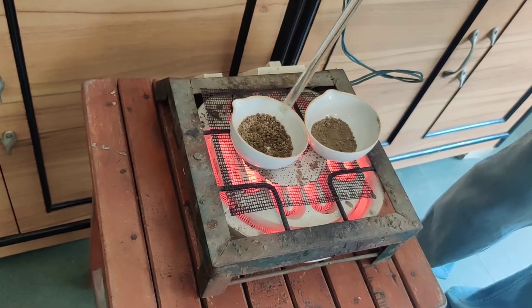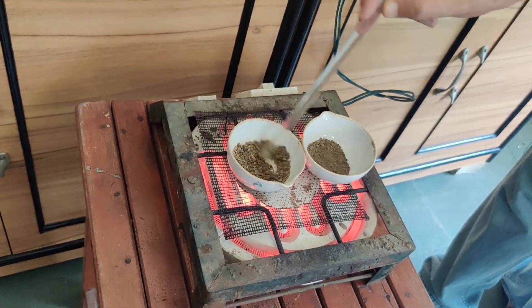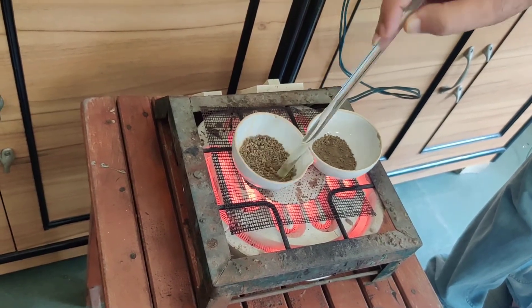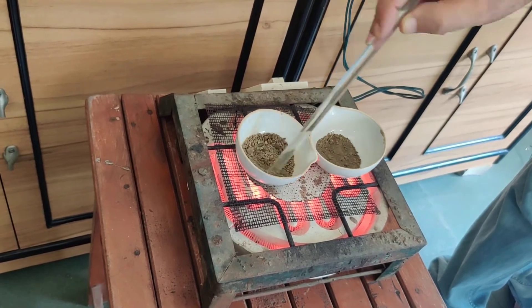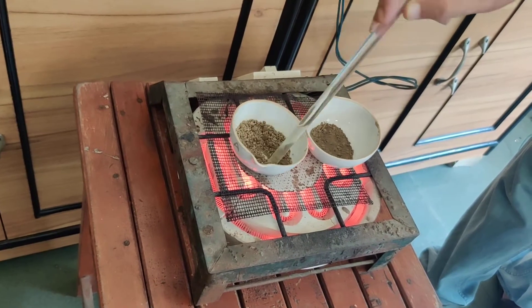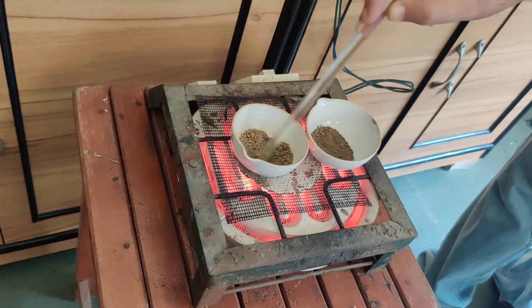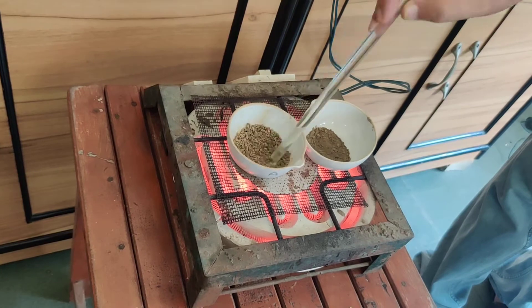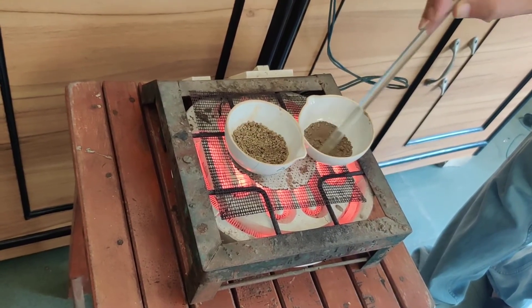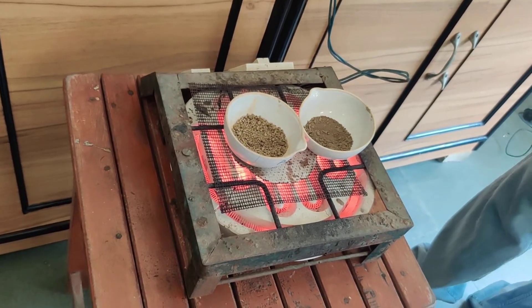A few more seconds it will take. Do it very carefully, because you will do this either on a spirit lamp or on an electric heater, so be careful. Now this sample is also dry. Now switch off the heater.